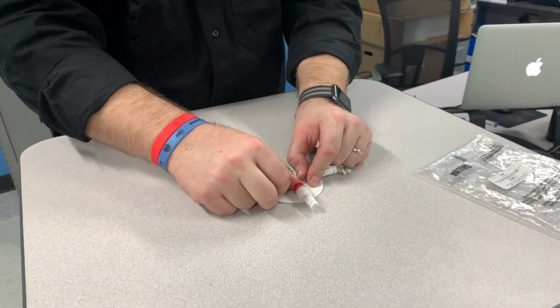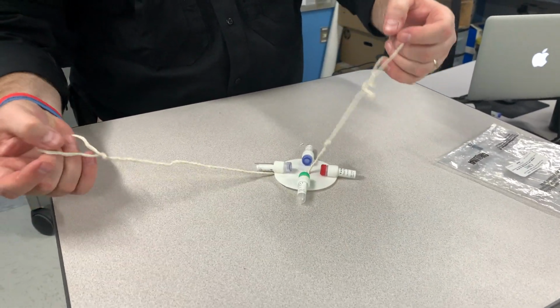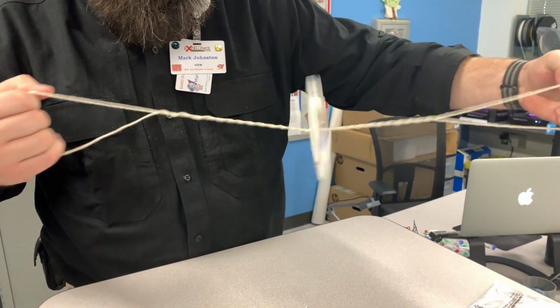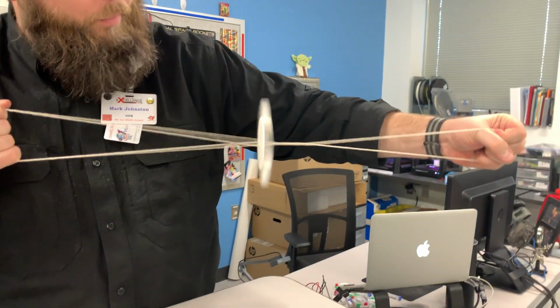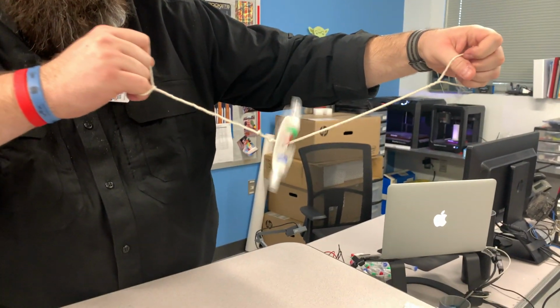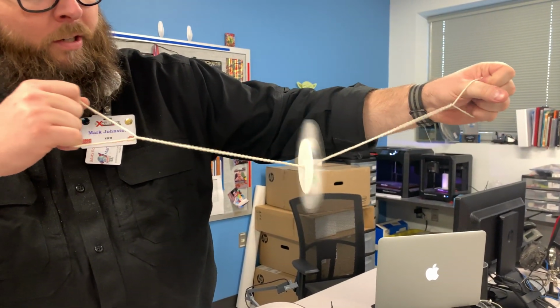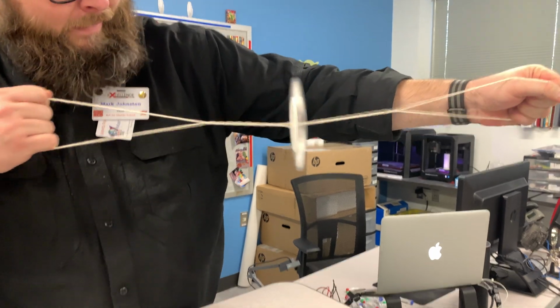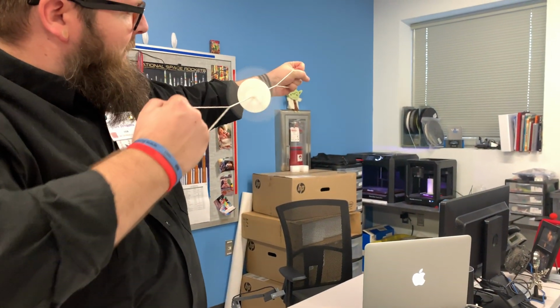Okay, so they had suggested using a centrifuge, but in a middle school we don't have a centrifuge. So I made this little guy. It's not my unique idea, but I did 3D print or design the little spinner and 3D printed it. So basically it's acting as a centrifuge.